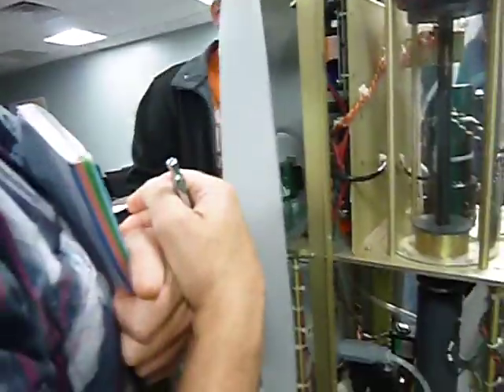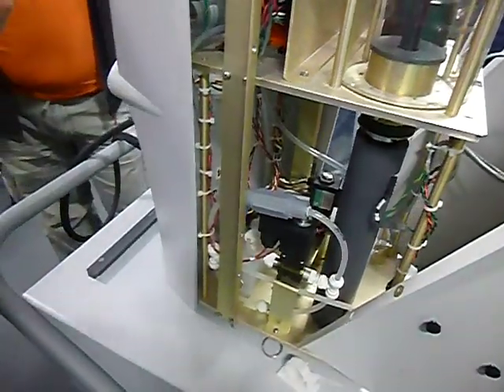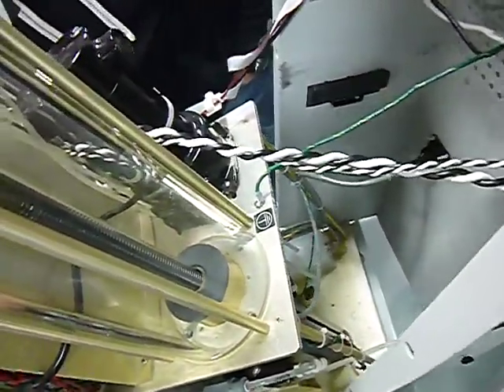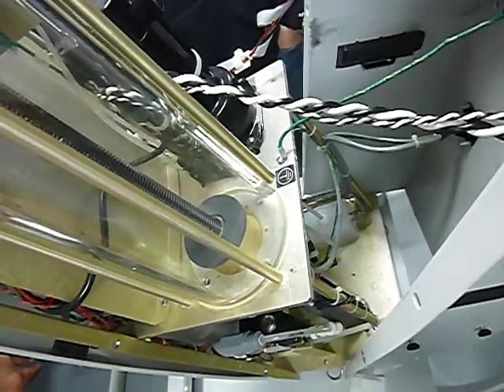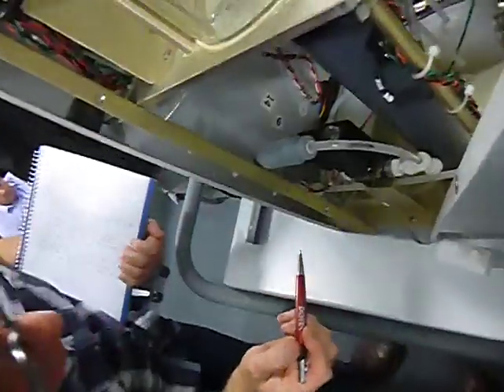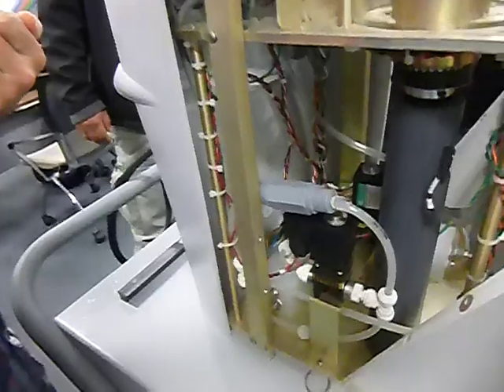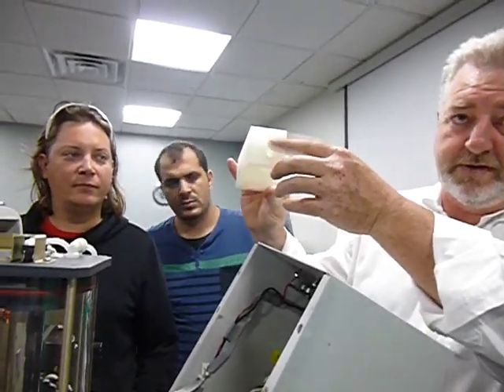All right. You got 2 heaters. What's attached to the heaters? Thermocouples. All right. Now also on the top of the heater, what do you got? Temperature sensors. Is this PT100 or what? No, the other one. You got the other temperature sensors on the top with the blue wires. See, this blue wire, and this is underneath. Ok. In the same resistance there is a thermocouple. That's this hole right here. PT100. The hole on the top is for the temperature sensor.